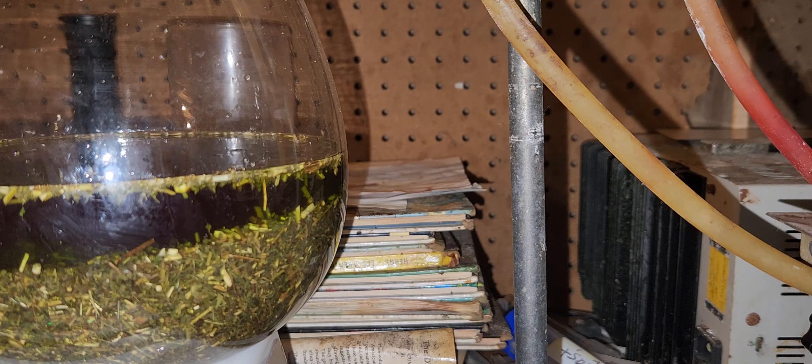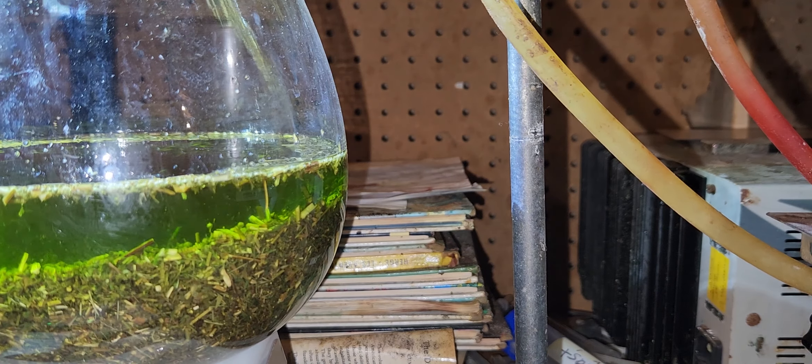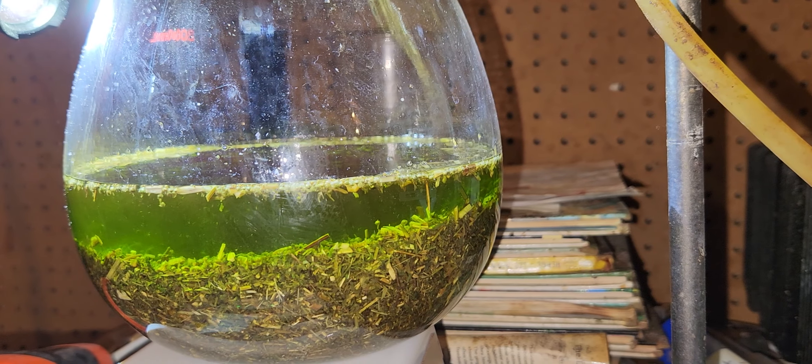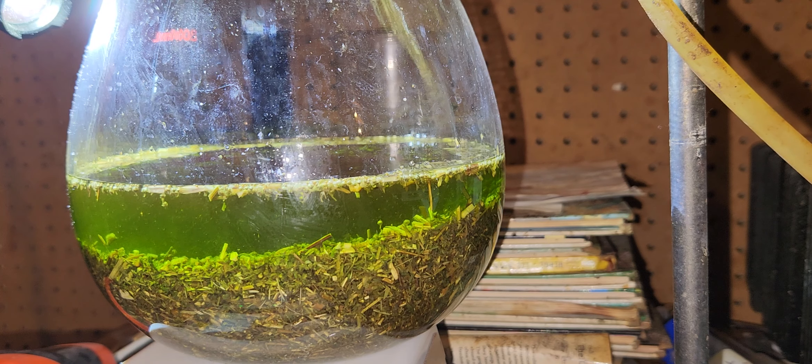I mean it's from when I poured it in, but what's happening is the resin is heating up, condensing, heating up, condensing, but it's not almost boiling. When it gets to about 45–50 degrees Celsius you start to see bubbles — which you can't quite see now, but you're starting to see bubbles.